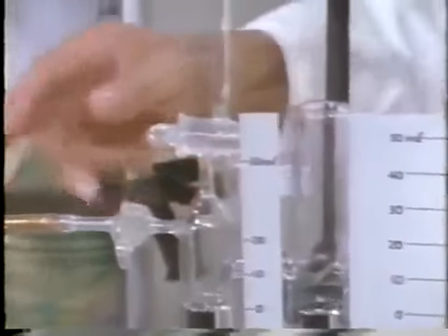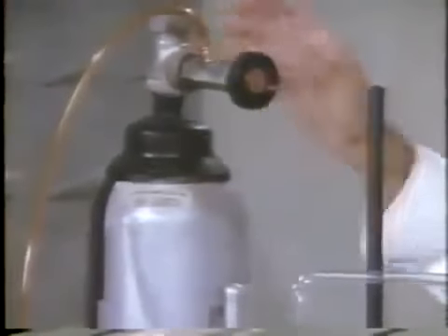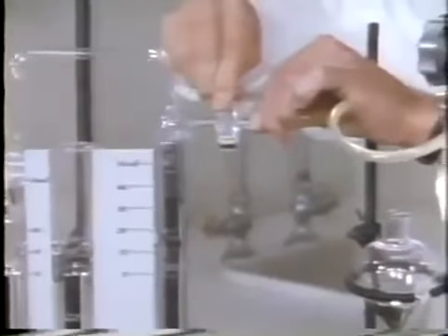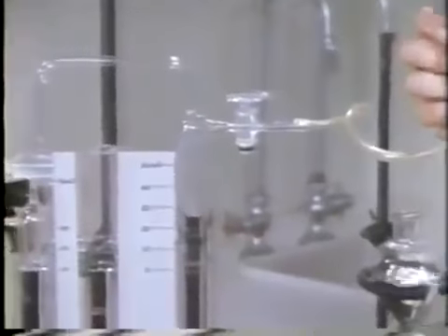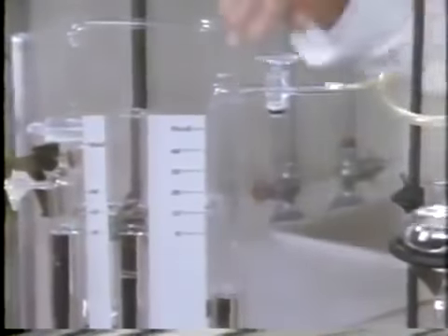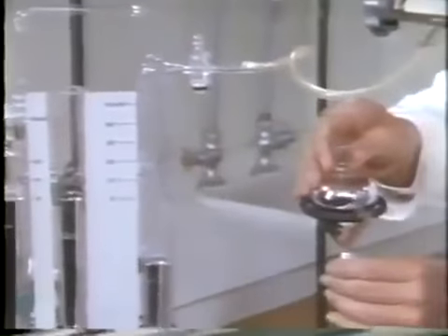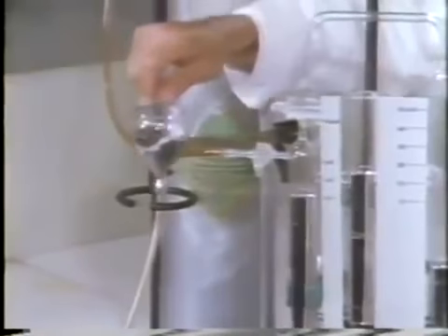This chamber has been filled with ammonia gas from this tank. It's connected through this tube to a similar chamber on the right. This one is now filled with mercury. When we open this stopcock, we can fill the right chamber with the second gas, hydrogen chloride. We have more than we need. This leveling bulb controls the pressure in the right-hand chamber. A similar bulb controls the pressure in the left-hand chamber.